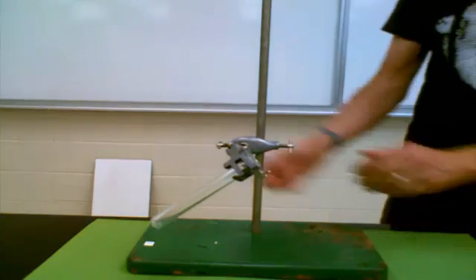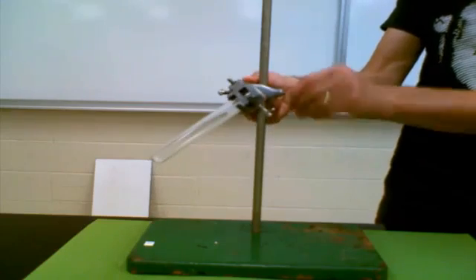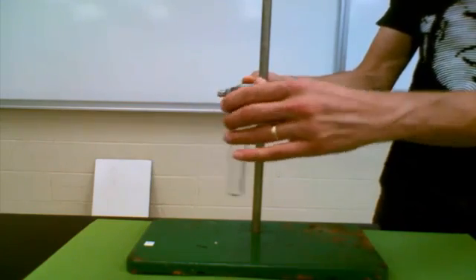Once it's in the clamp, you can adjust all kinds of things.